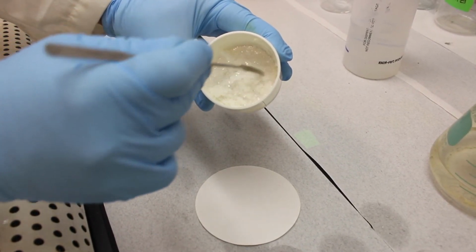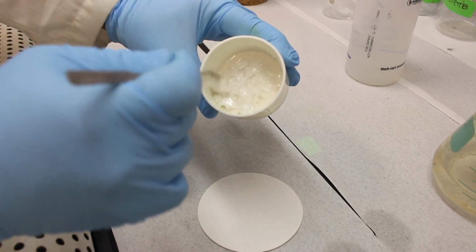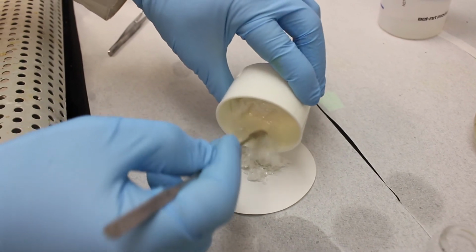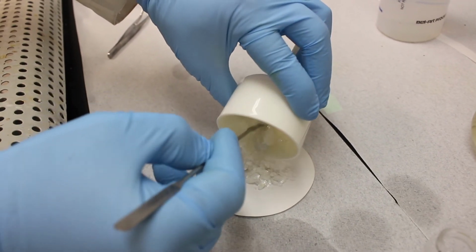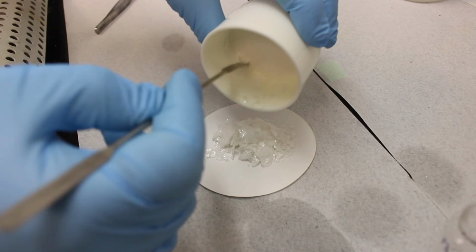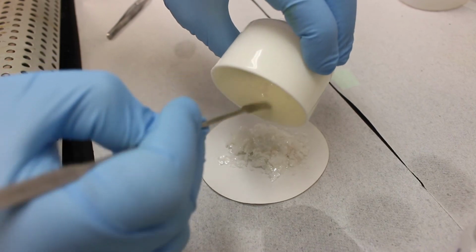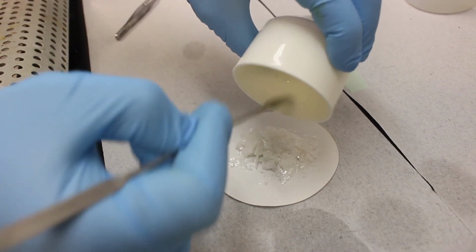It's kind of difficult in front of the camera, but you can see these nice fluffy crystals. They're much larger than the solid from the reaction mixture, which tells us that they should be fairly pure and hopefully in a high yield too. So we'll try to just empty them onto the filter paper without spilling. And you can spend a lot of time trying to get every little crystal.